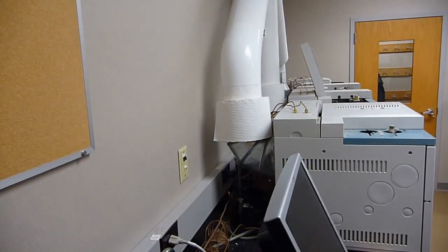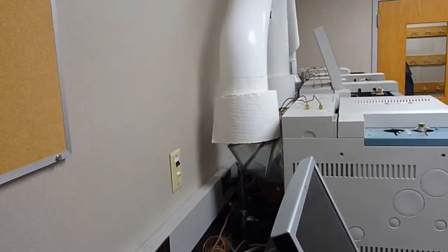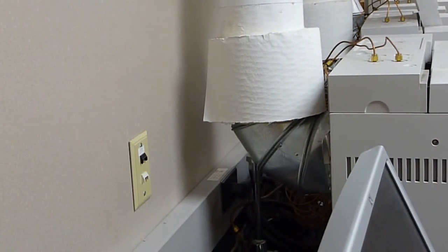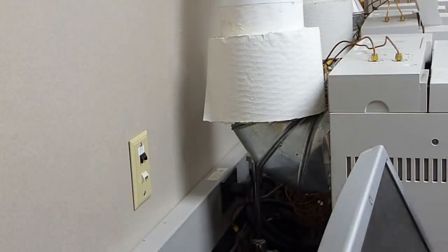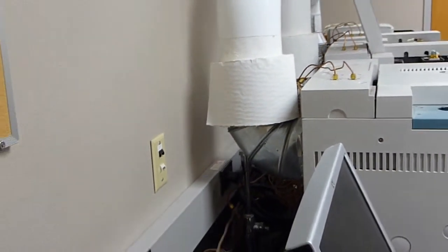So far, we've turned off the heaters for everything else, cut the flows going to the GCs after everything's cooled down to room temperature. And now we have to start disconnecting the GC from some of the HVAC system exhaust. One of the things we had done was we made a custom deflector out of a 6-inch ductwork adapter. And that makes its way into the return portion of the HVAC system. And we have to disconnect that, take off the insulation, disconnect it. So, that is step one.